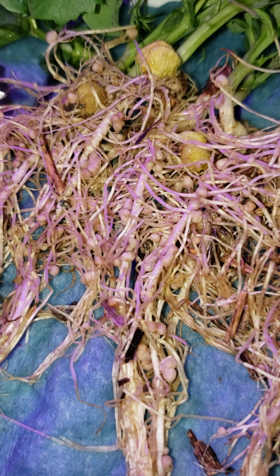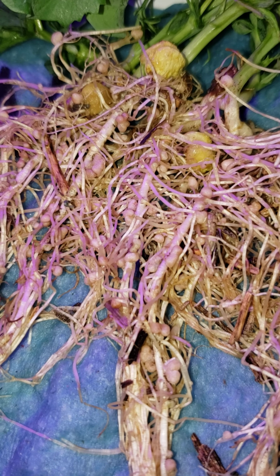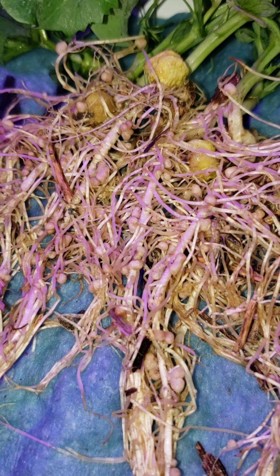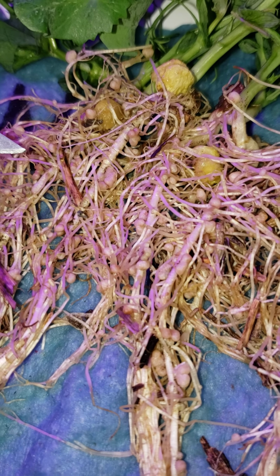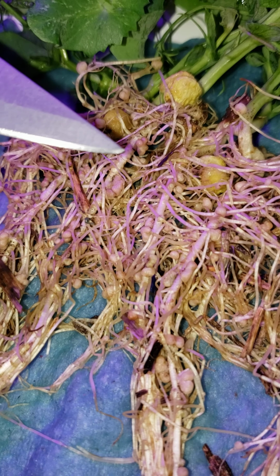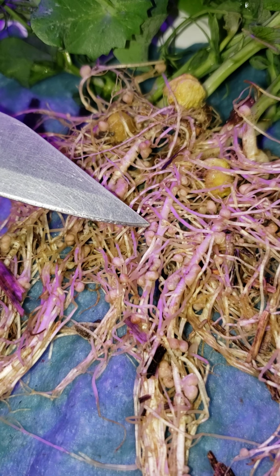So when the soil is low in available nitrogen, as this soil is, and no fertilizer was added, the low availability of nitrogen signals the plant to produce signal molecules that encourage or allow those rhizobium to enter into the roots, and the rhizobium bacterium then to initiate the formation of a nodule, as we see here.